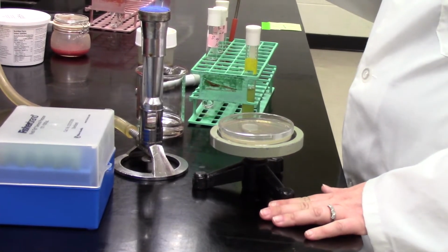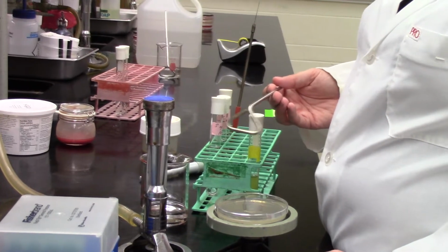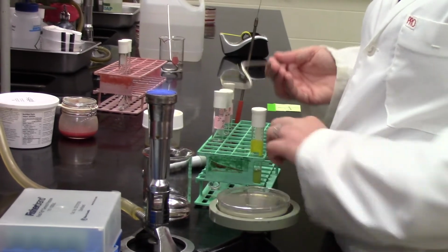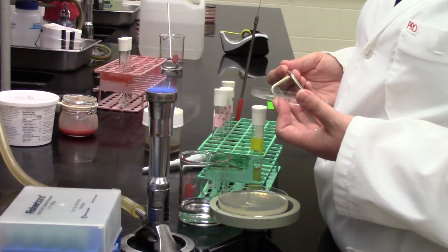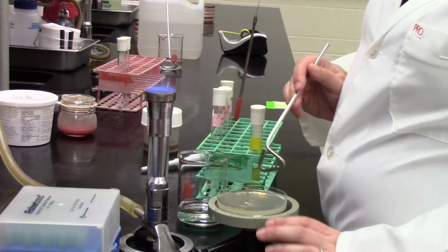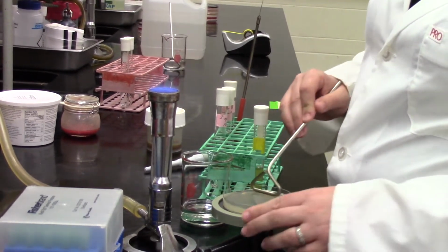All right, so Sabrina's getting ready to do the spread plate. She's just waiting now. She actually did the quick flame off of the ethanol. You can see the ethanol beaker hiding behind the Bunsen burner there. And now she's ready. It's probably cool because remember, you're never getting that spreader really red hot. You don't have to hold it in the flame because it's sterilized essentially by the 70% ethanol. Now she's ready to spread.